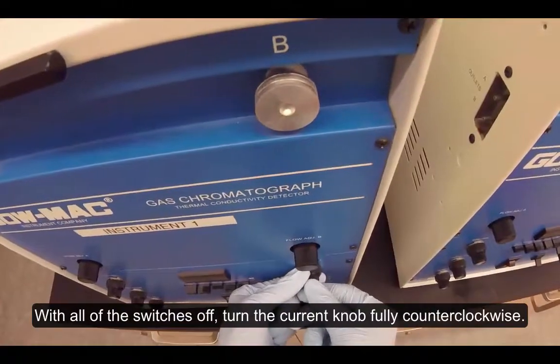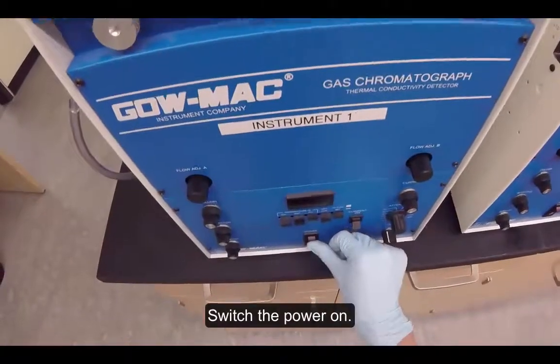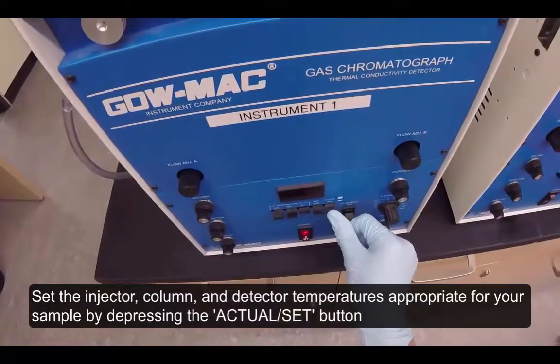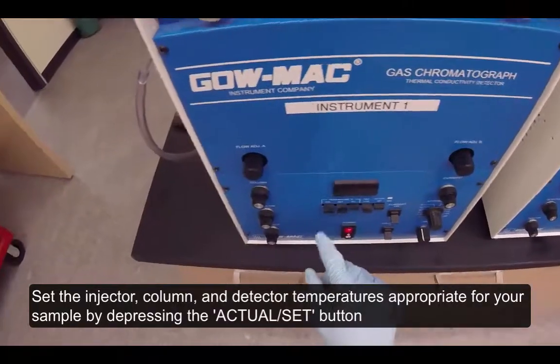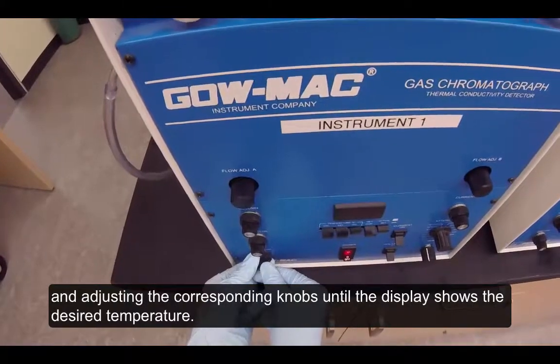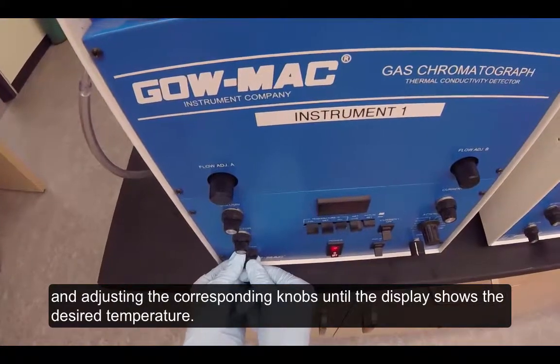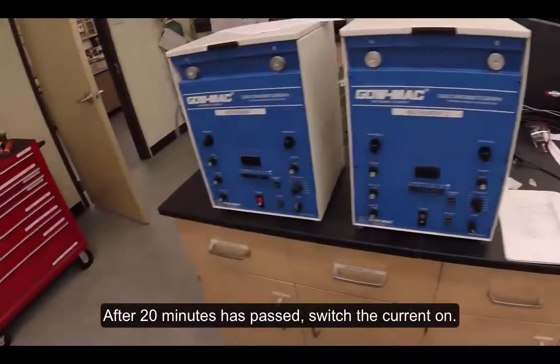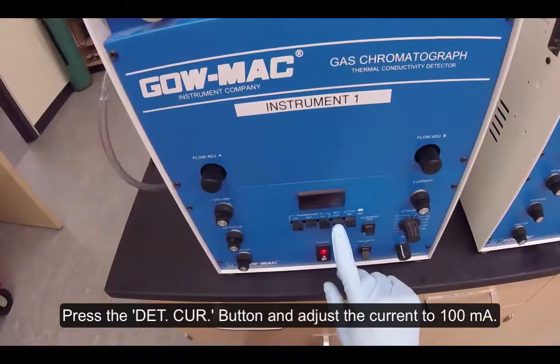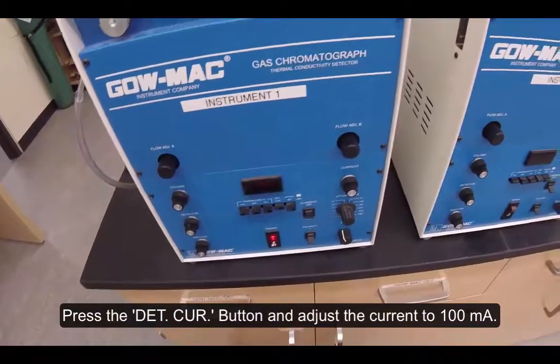With all of the switches off, turn the current knob fully counterclockwise. Switch the power on. Set the injector, column, and detector temperature as appropriate for your sample by depressing the actual set button and adjusting the corresponding knobs until the display shows the desired temperature. After 20 minutes has passed, switch the current on. Press the detector current button and adjust the current to 100 milliamps.